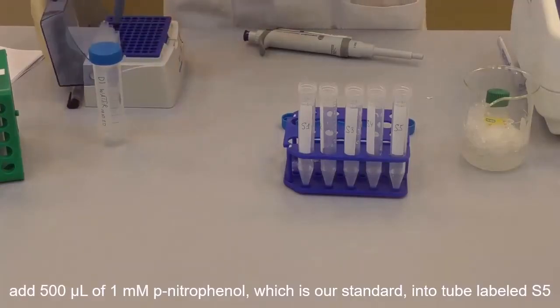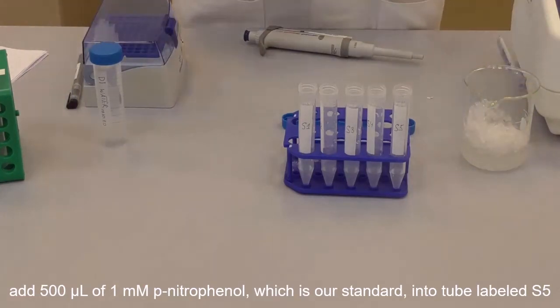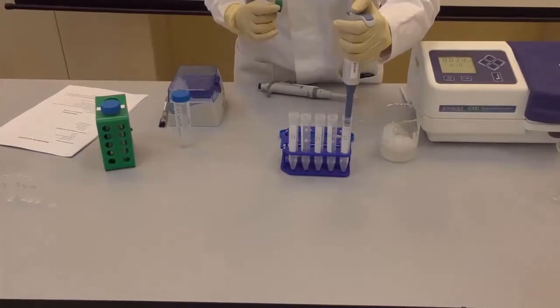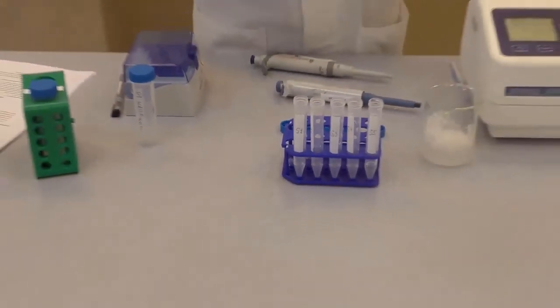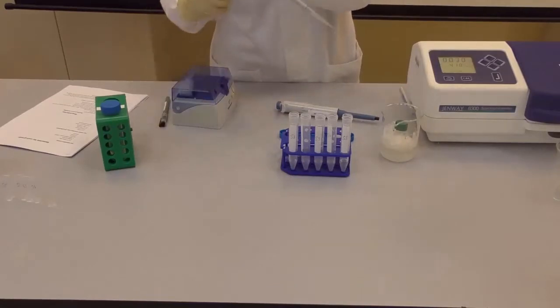Add 500 microliters of 1 millimolar p-nitrophenol, which is our standard, into the tube labeled S5. Add 750 microliters of DI water to the same tube.